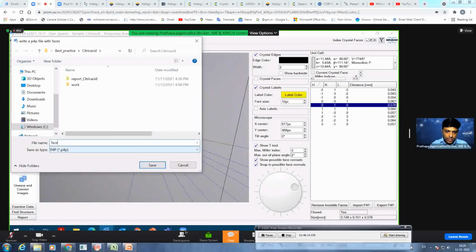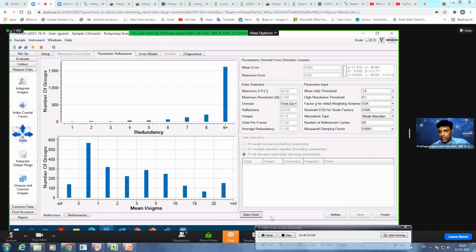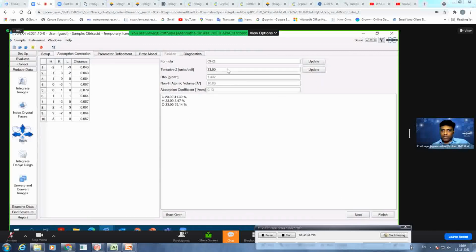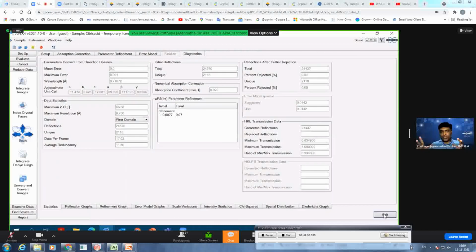So this index save. Then I go to scale. When I click on scale, if you have done the face indexing, you can go to numerical mu calculated, and then you can start here, the same way you have done it, or you can go to numerical mu from formula. Then you can start it here, and you can give the exact formula of your compound, how many atoms exactly, so that will help you. Then update. For example, if you have 4, you can update that, and then you see it tells you exactly how many elements you have. Then you click on finish or next, exactly as you do it in the setups. The only thing is, now you are considering the exact size and exact shape of your crystal. That's what you are using for scaling.